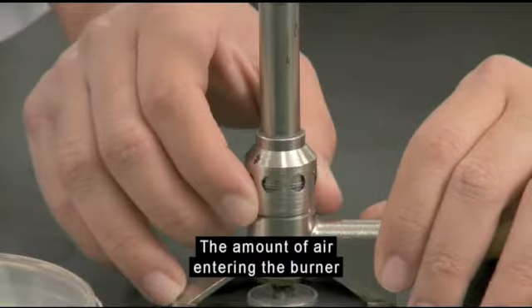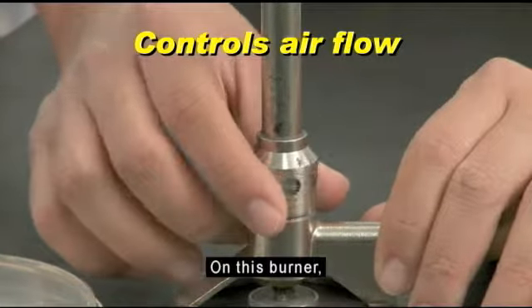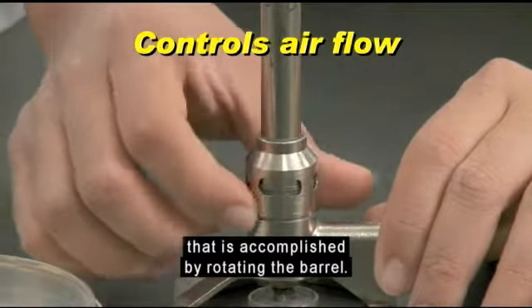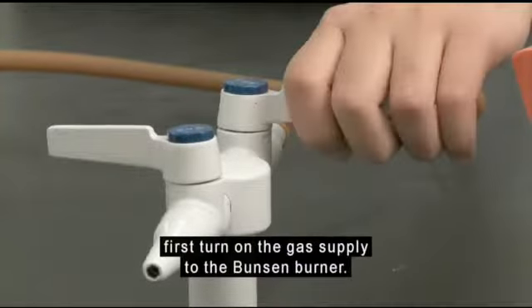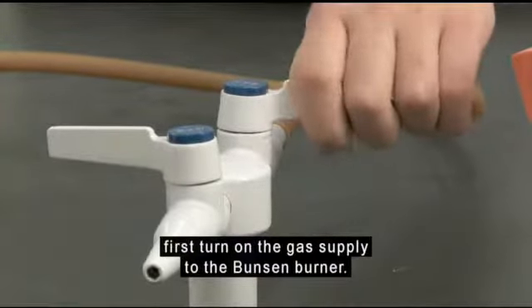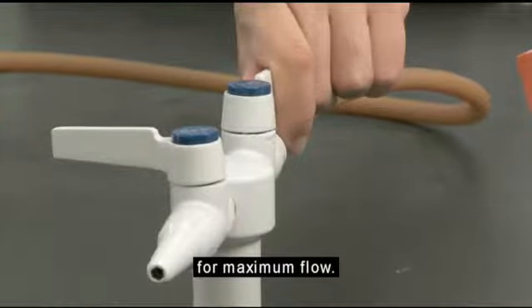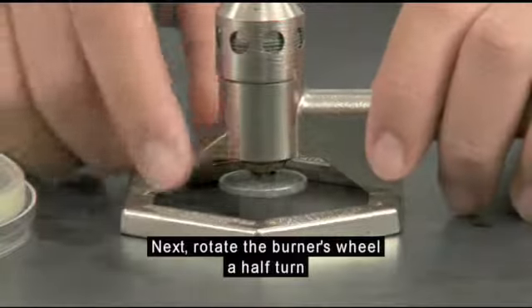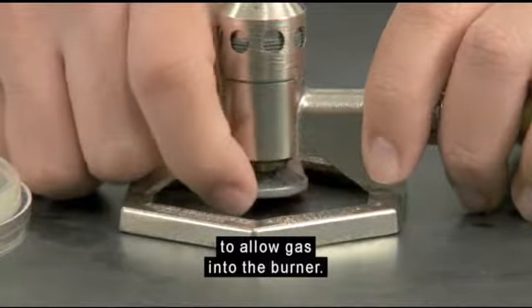The amount of air entering the burner can also be controlled. On this burner, that is accomplished by rotating the barrel. To light the burner, first turn on the gas supply to the Bunsen burner. The handle should be parallel to the gas nozzle for maximum flow. Next, rotate the burner's wheel a half turn to allow gas into the burner.